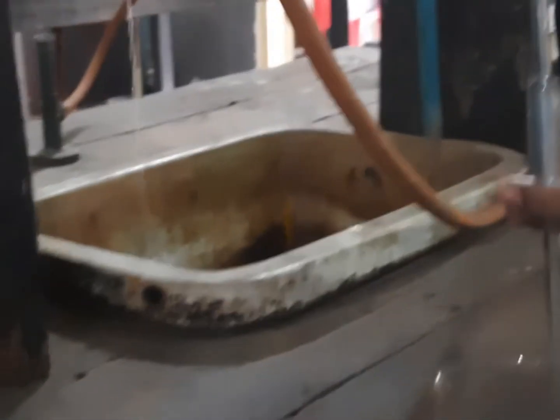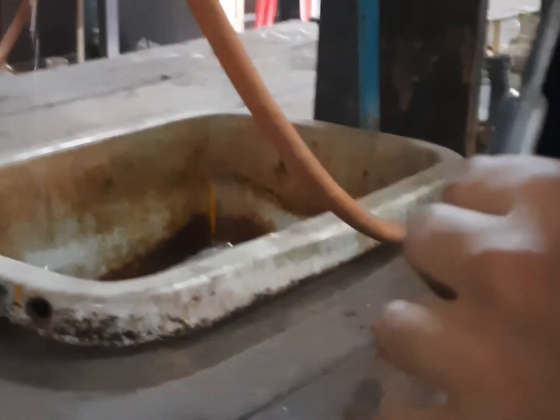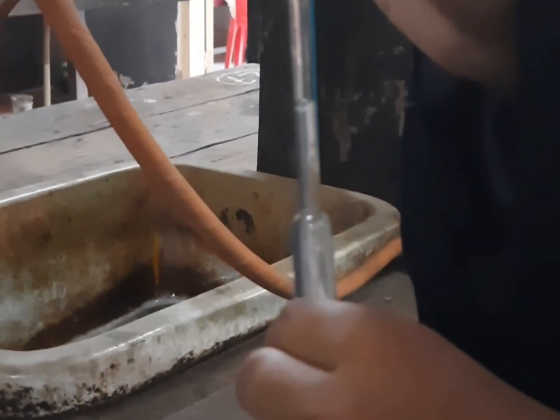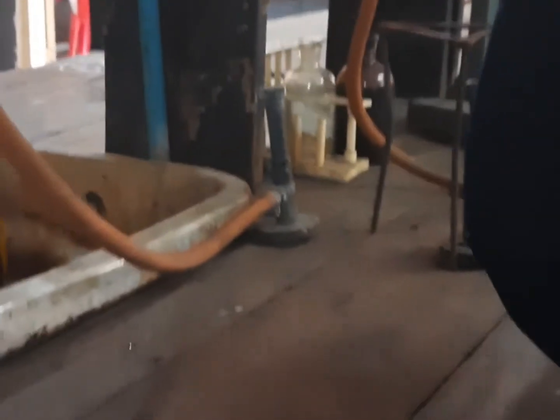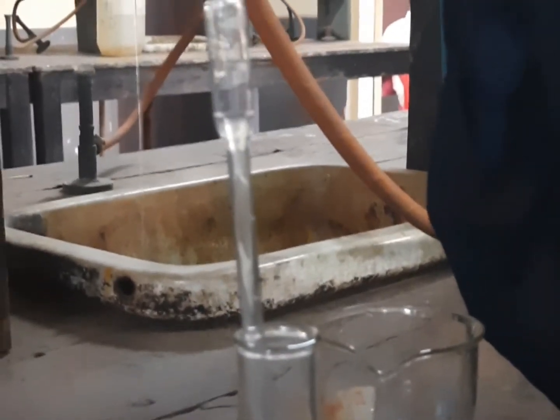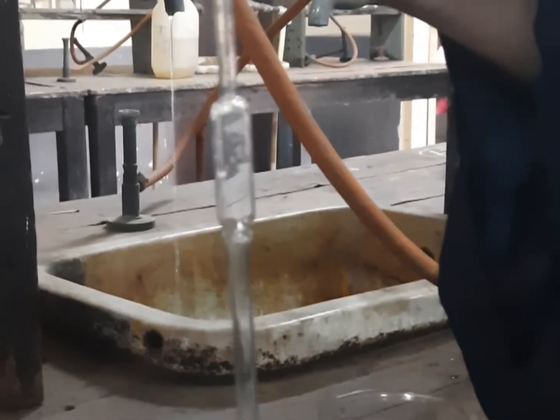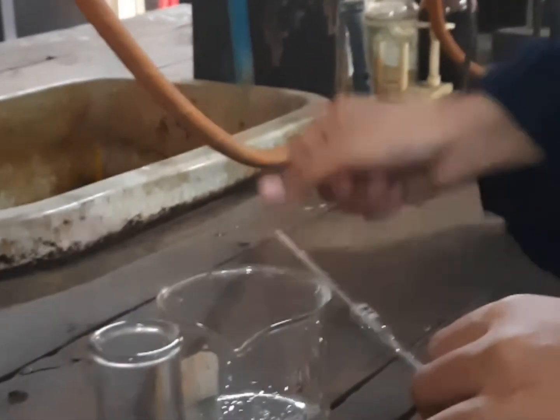Pipette out 10 cm³ of the mixture of sodium carbonate and sodium bicarbonate with the help of a pipette. Always rinse the pipette first, then pipette out the solution. Adjust the lower meniscus on the marking of the pipette. Transfer the solution into the conical flask and slowly remove the last drop remaining inside the pipette, because that last drop will affect the burette reading.